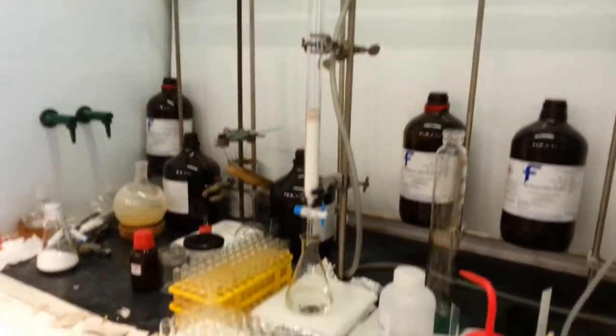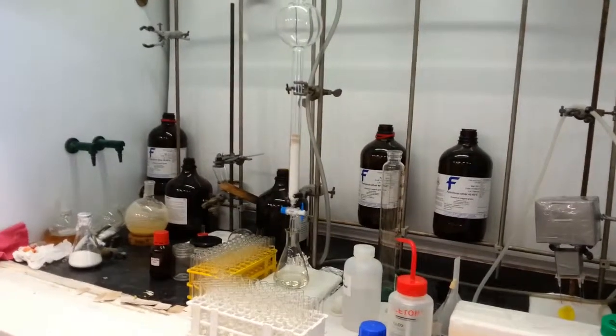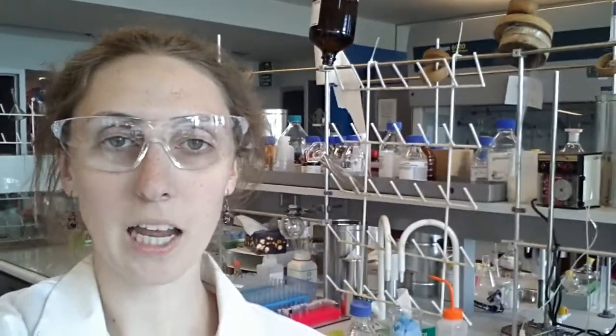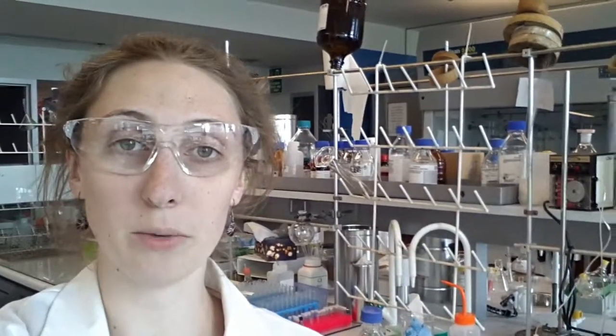A lucky organic chemistry lab has this machine here, which is an automated way of doing column chromatography. The manual version looks like this. Column chromatography is a method for separating materials to purify your compound. It's kind of complicated, so I'm not going to go into it here. Organic chemistry labs don't really have many machines in them. Everything we do here is done pretty manually. The machines we do use regularly are much larger, much more expensive, and generally are kept in their own facilities somewhere else in the building.